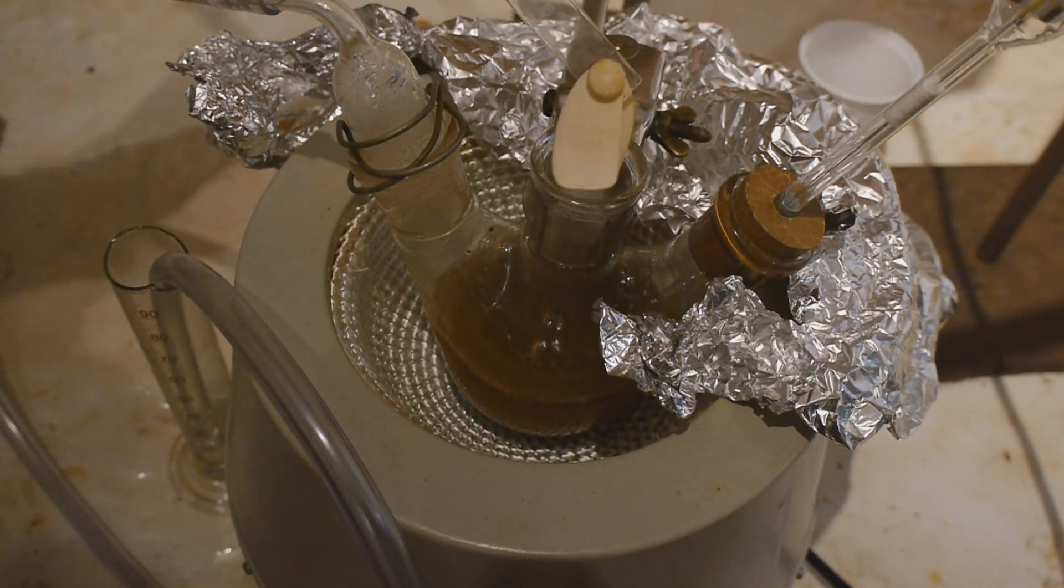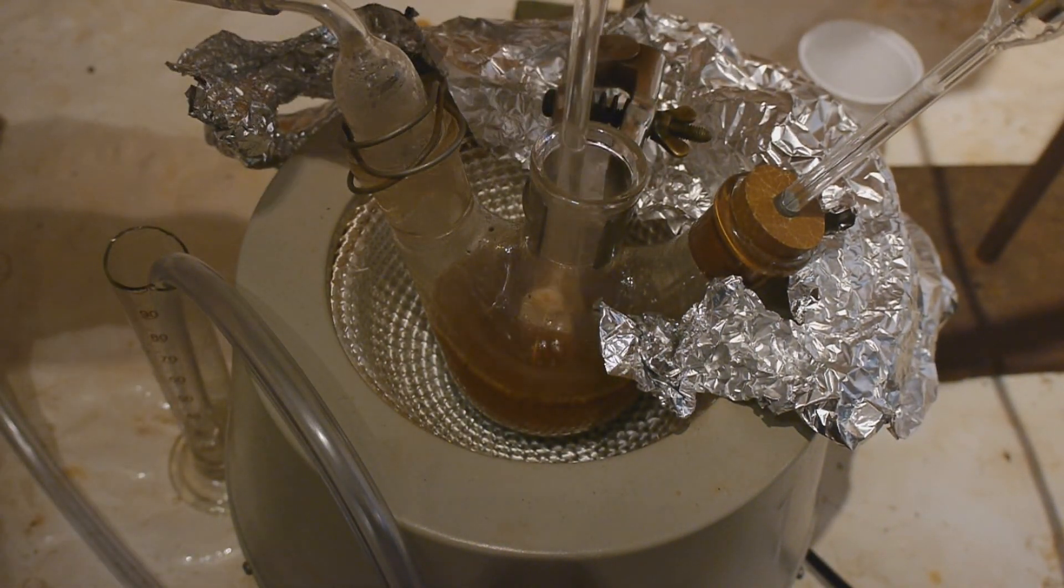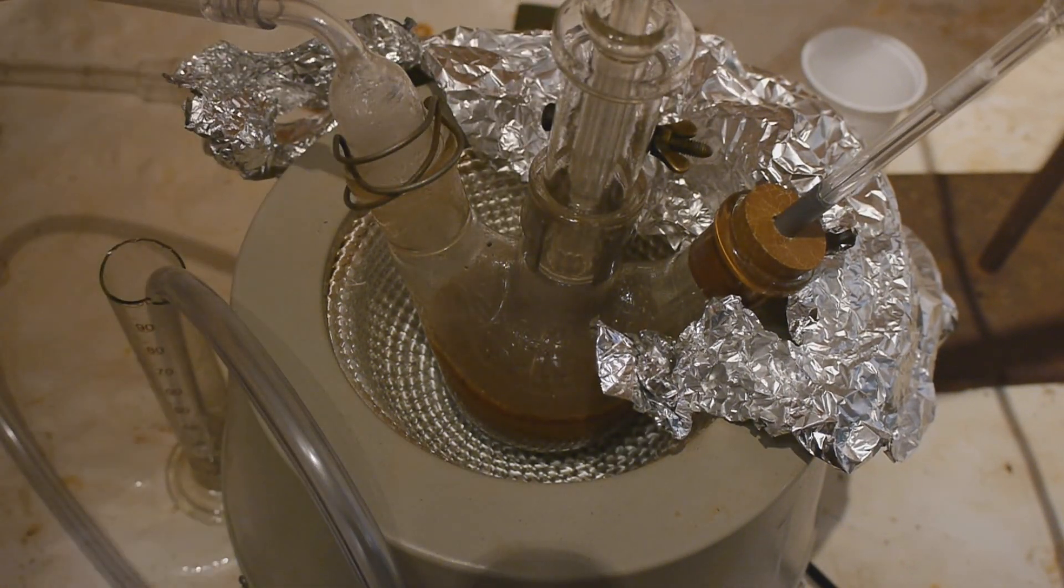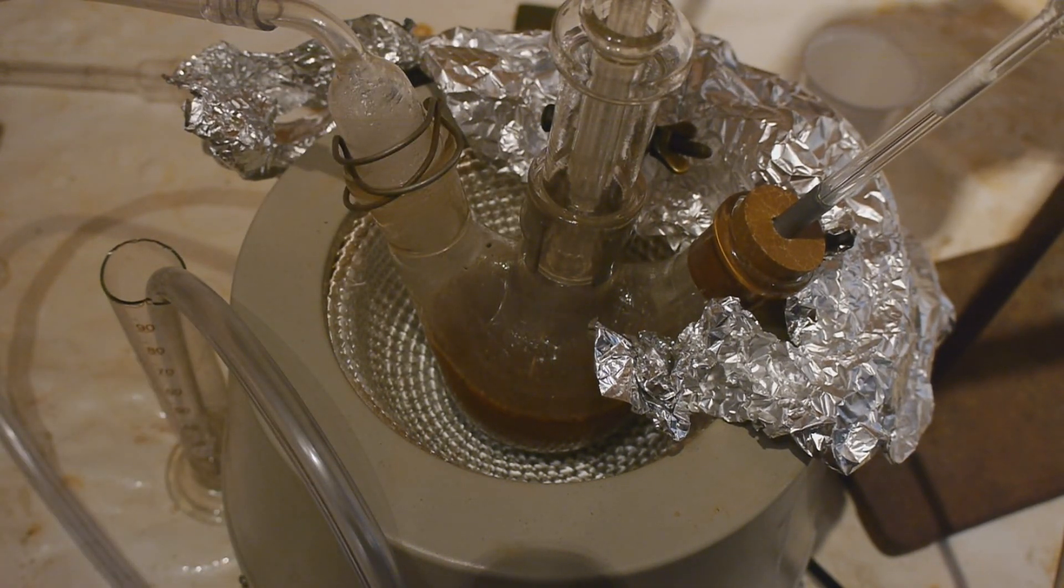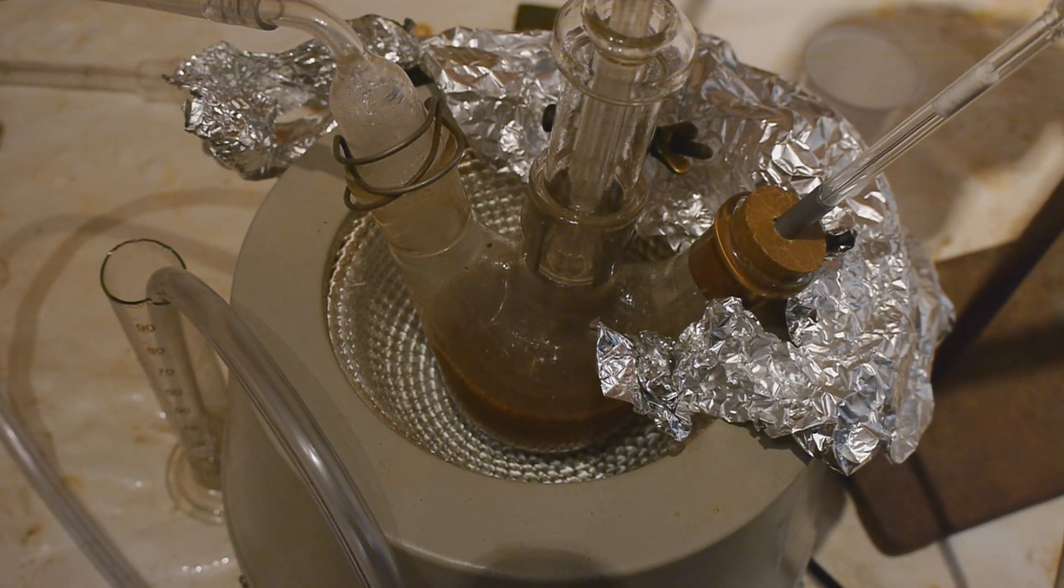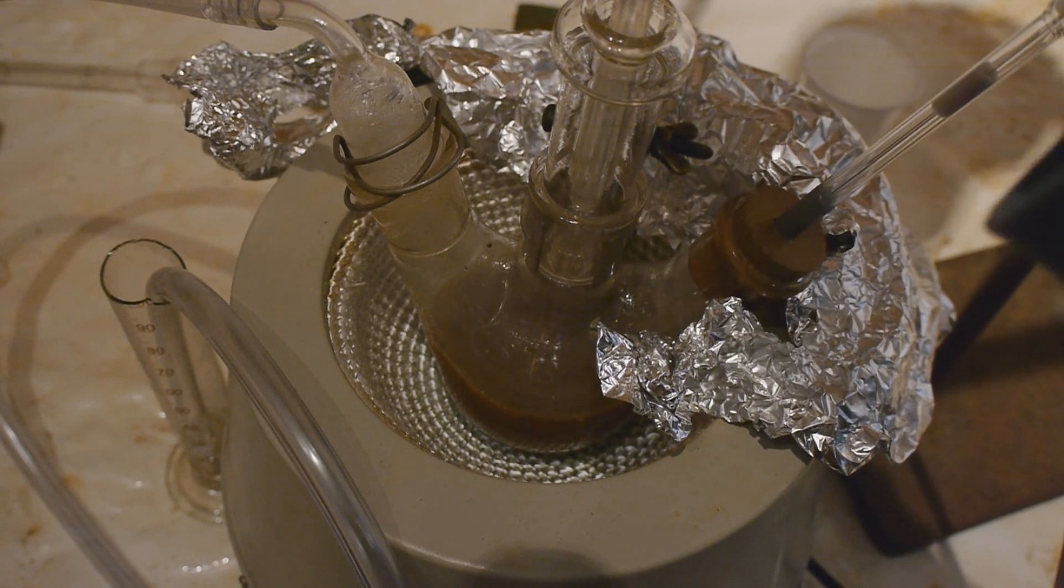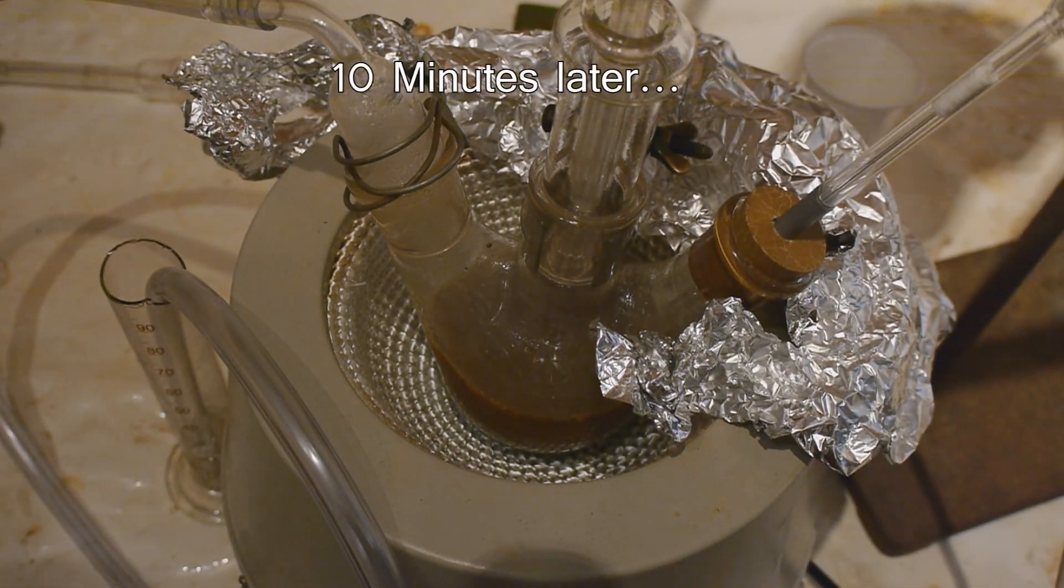Alright to help myself with that, I will insert an external stirrer. Okay let's try to run this now. What happens if I turn that on? It doesn't stir of course. Amazing.